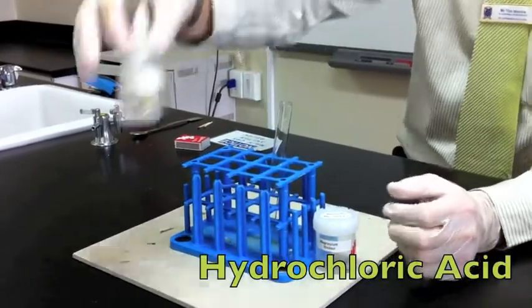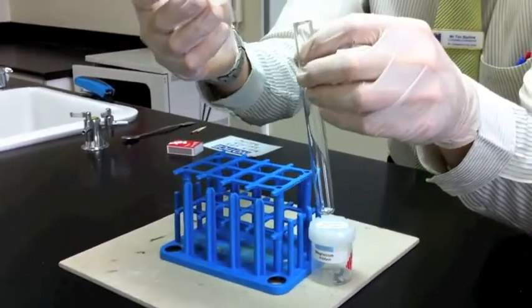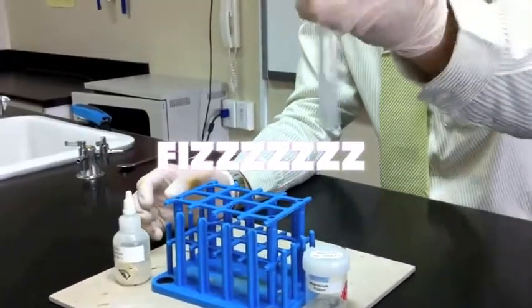So this is quite a dangerous acid. So let's see what happens. So I'm going to pop the two together. And straight away it starts fizzing quite a lot.